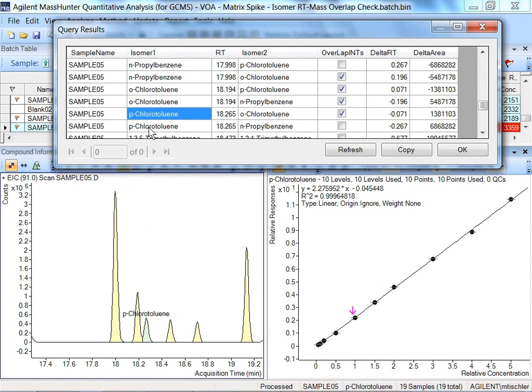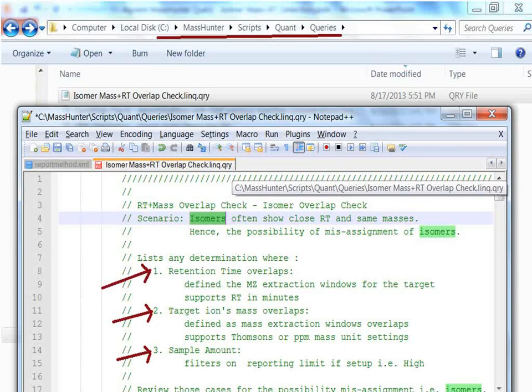And I can see that those did get assigned, but I'm indicated to review them because they do overlap in integrations and their delta RTs are very close. So this will allow you to zero in and review determinations to make sure they were assigned correctly. That's the definition of this query, which lives in this directory, Mass Hunter Scripts Quant Queries, the definition.